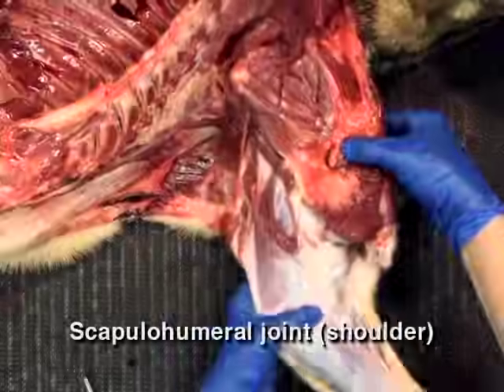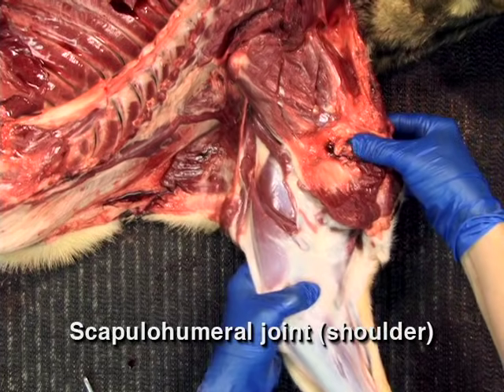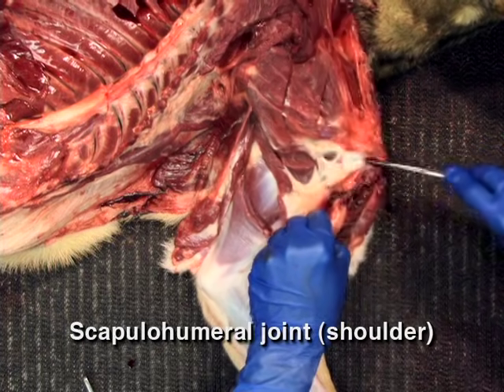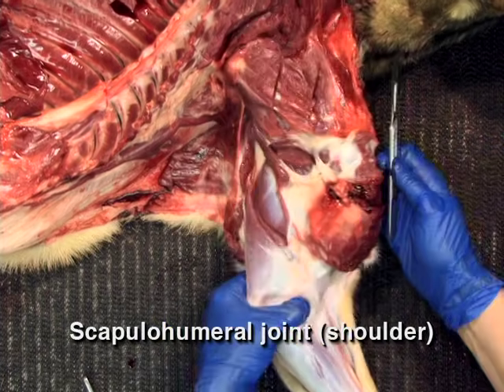Opening the joints. Remove the skin over several joints and open them carefully to minimize contamination with bacteria.